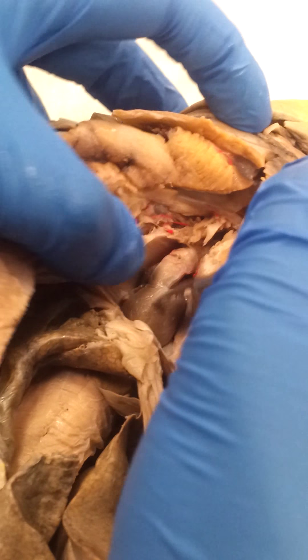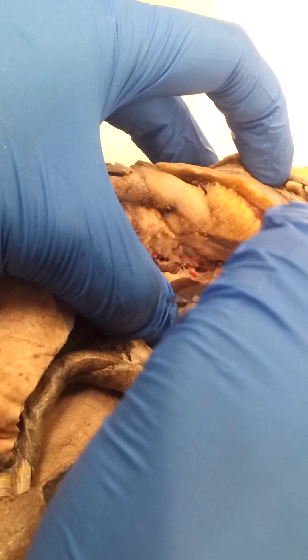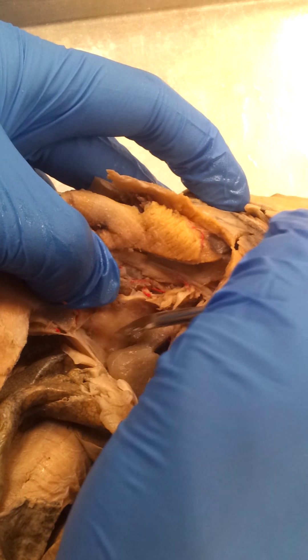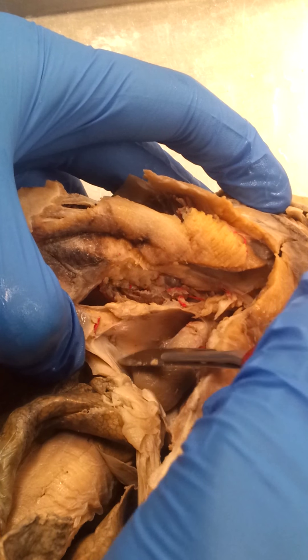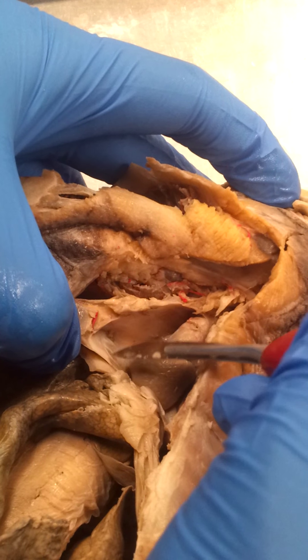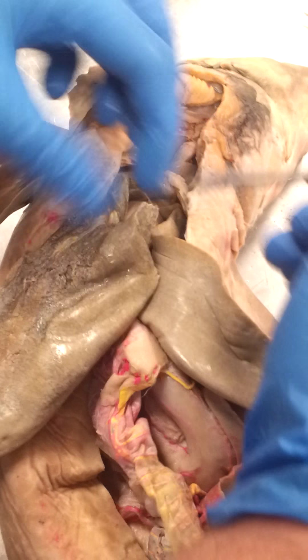Going down to the heart, which has ventricles on it. To the left of the heart, this tissue right here is the parietal pericardium. This blue tissue right here is the sinus venosus, and then we have the liver protruding to the heart — that's this whole piece right here.